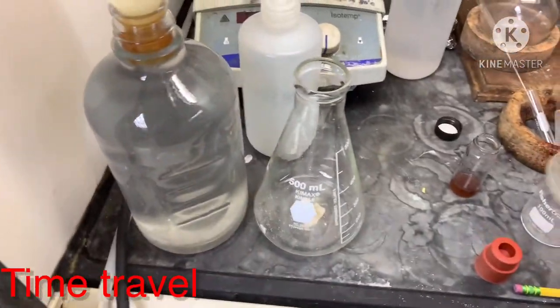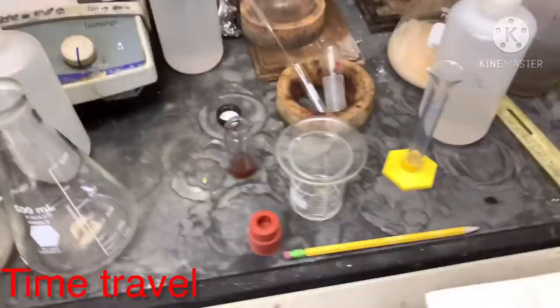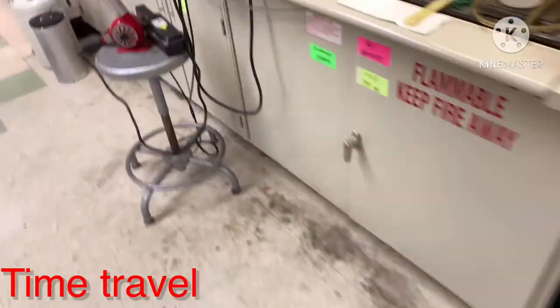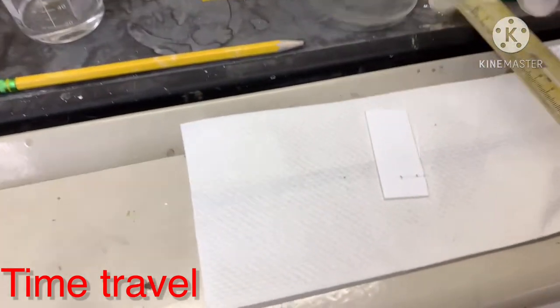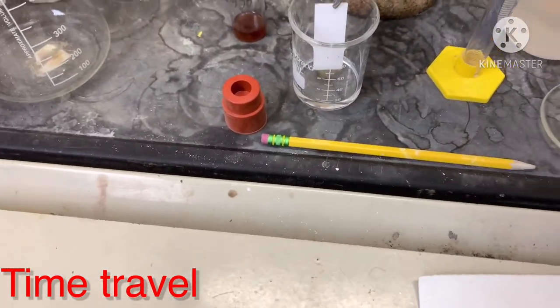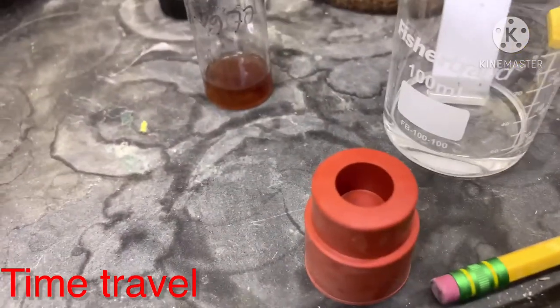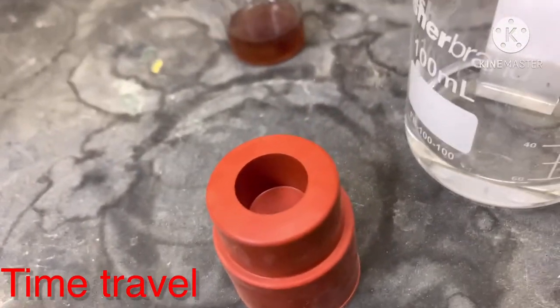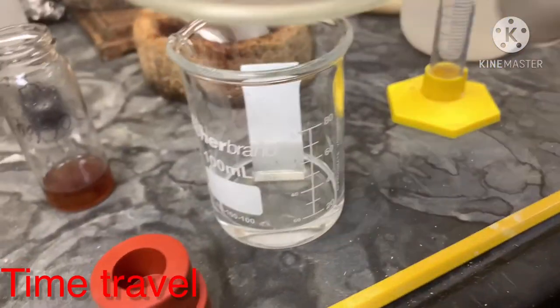I take a 100 mL beaker and pour the solvent into it. Now I pick up the TLC plate with tweezers — do not touch the TLC plate with your hand. Insert the plate into the beaker and make sure it is slightly inclined against the wall, not completely straight, so the solvent can climb up quickly. Then cover the beaker with a watch glass and wait for the solvent to rise.